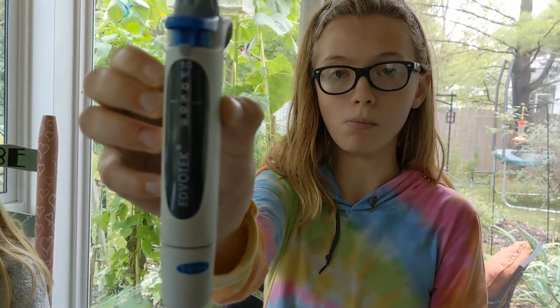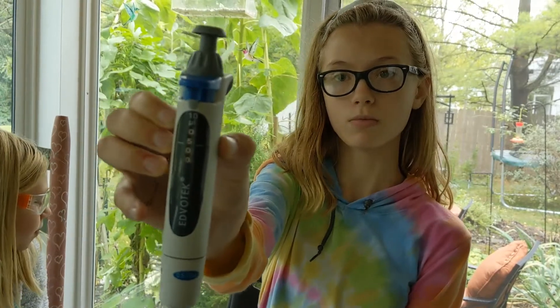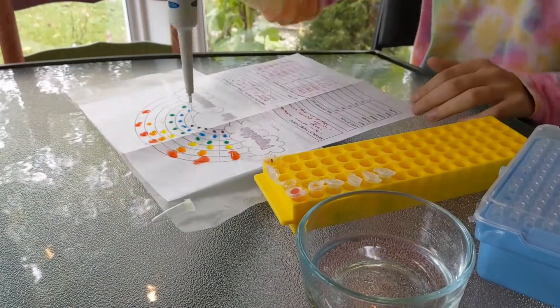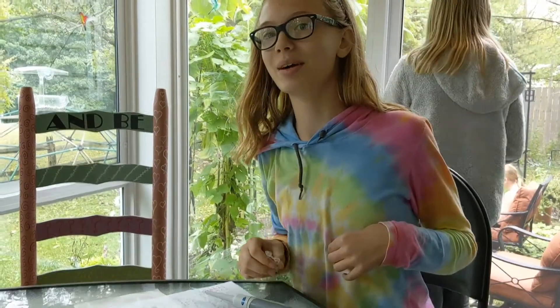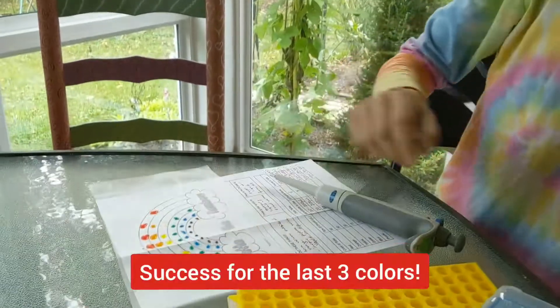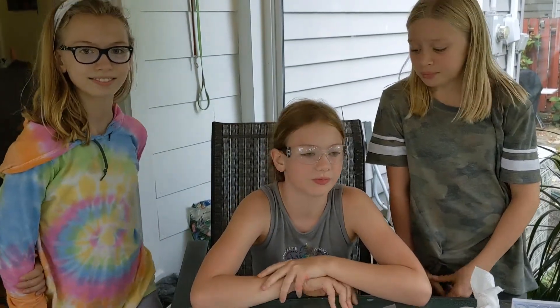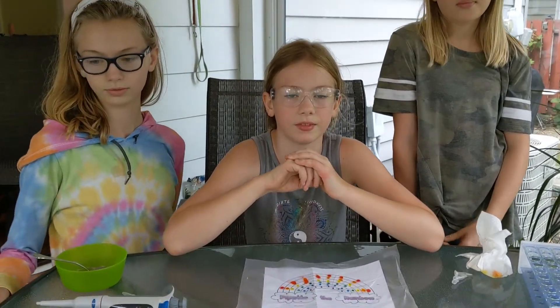Anna is going to do purple. I got enough too. We all know how to pipette — it was just the tubes. Your teacher didn't put enough liquid in the tubes. This is why teachers should always check their own protocols first.